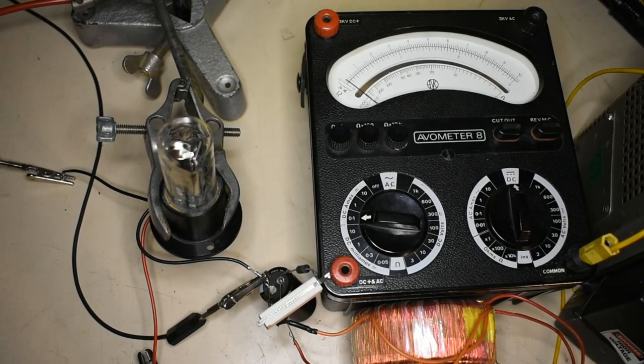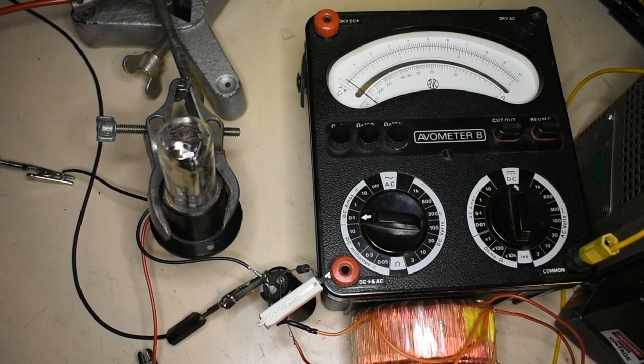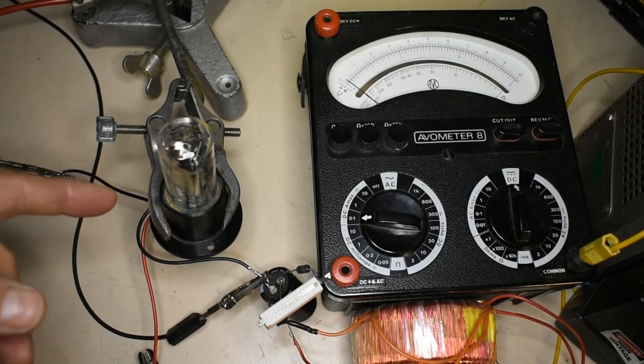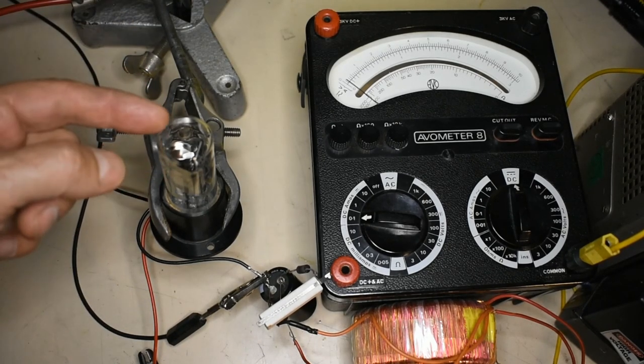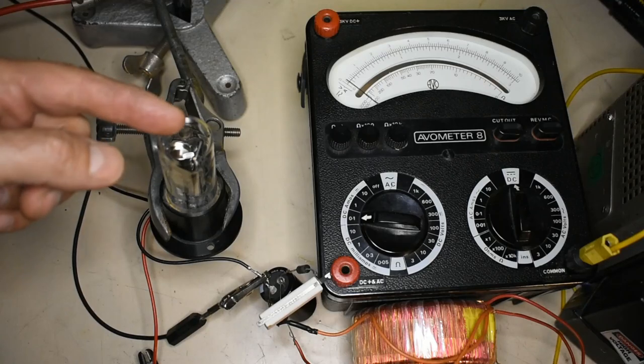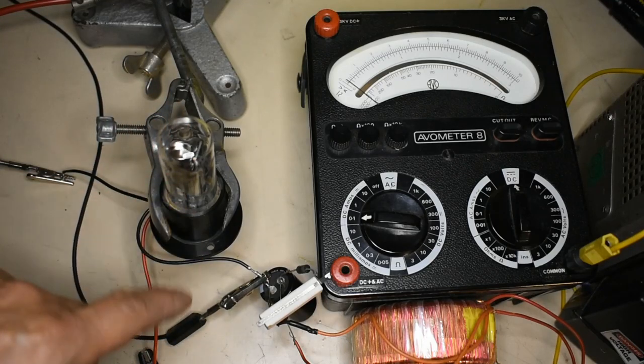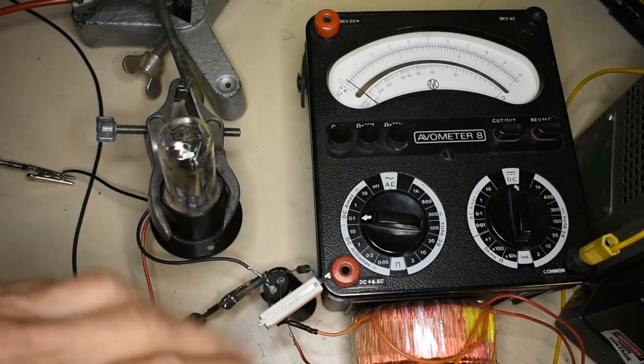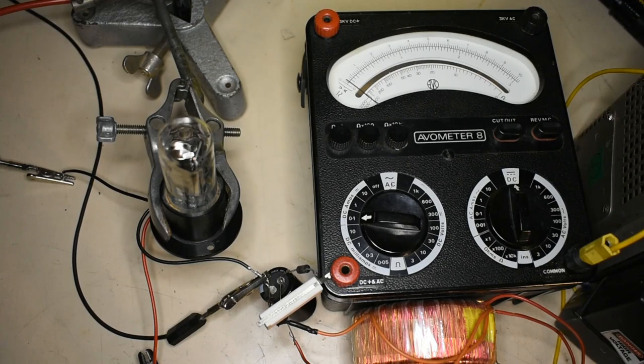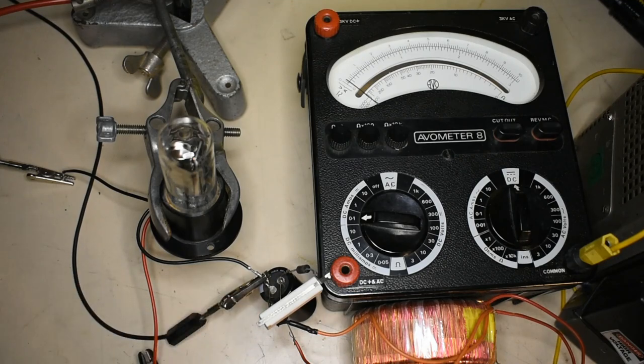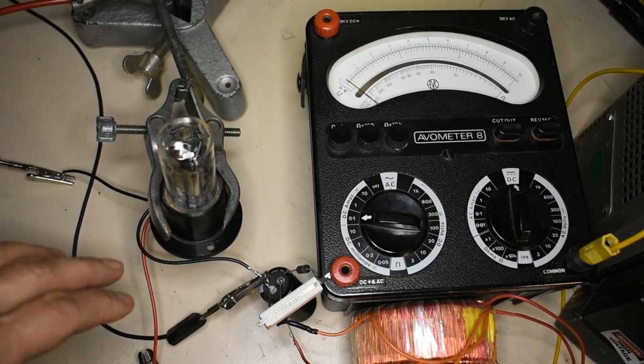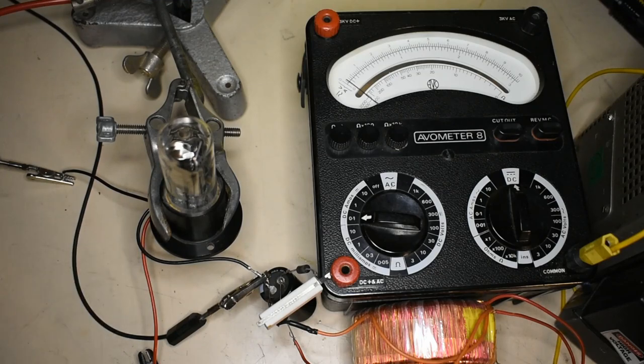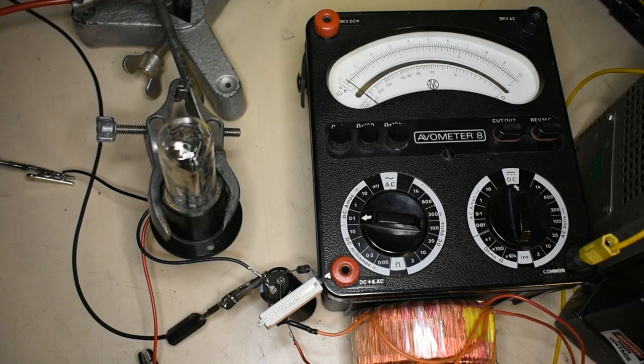Okay, I've got a very basic setup to drive one of these deuterium lights. I've got the lamp itself sitting here and we have a power supply onto the anode plate which is a DC variable supply between zero and about 200 volts. I've also got a heater connection which is quite low voltage which is across the cathode heater.